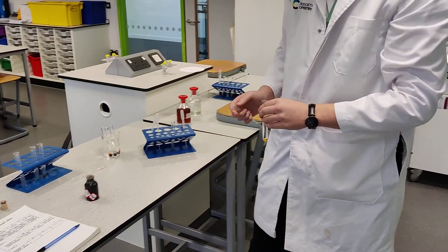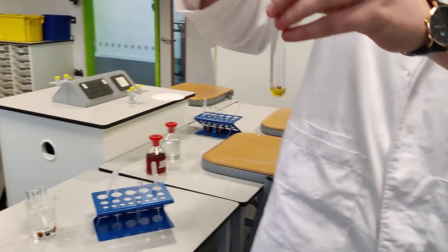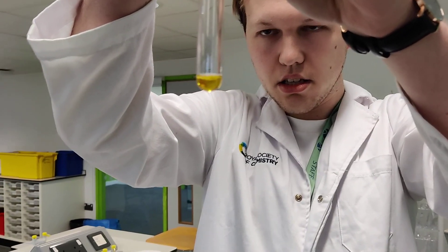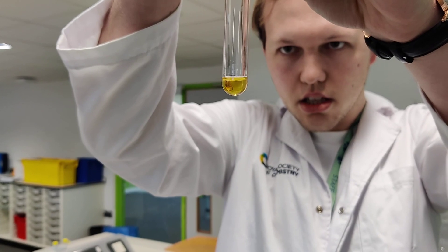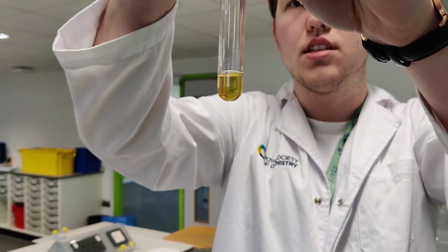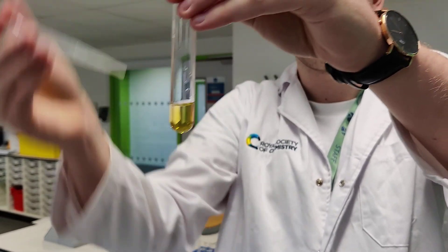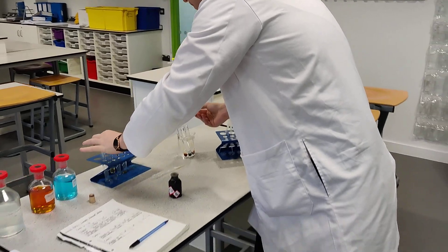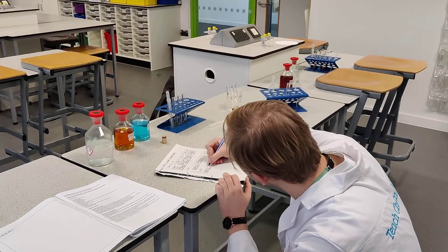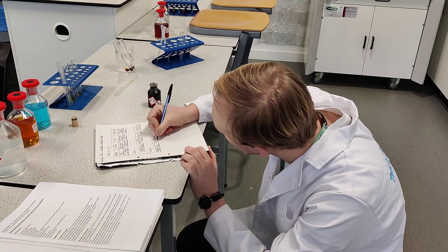So we've got our solution Q. We're going to add a couple of drops of silver nitrate, being careful not to get it on our skin. So I've added quite a lot now and there doesn't seem to be any change at all. So let's note down no observable change for Q.